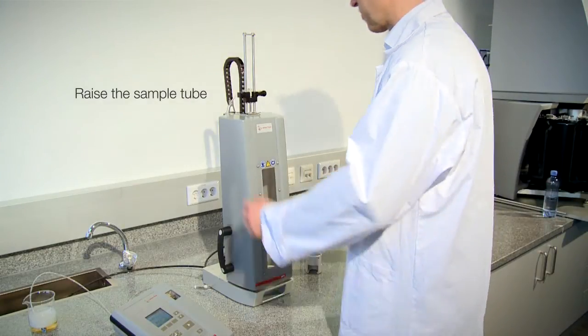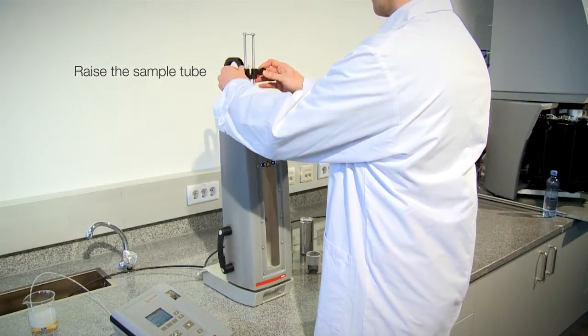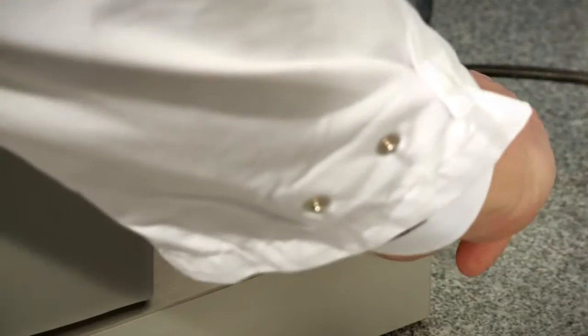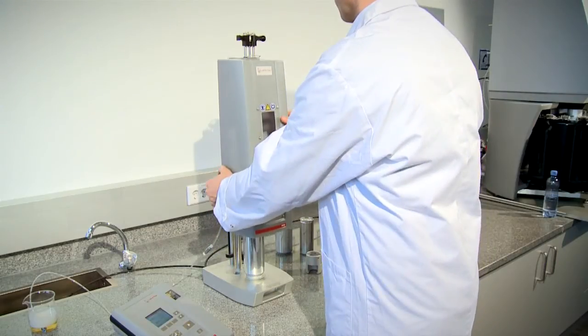After the measurement, lift the tube, release the pressure and remove the sample.